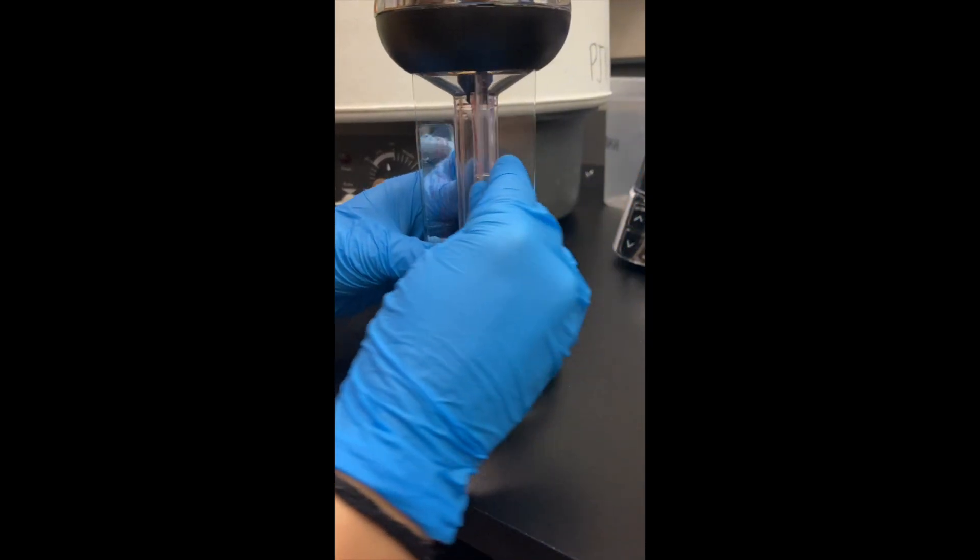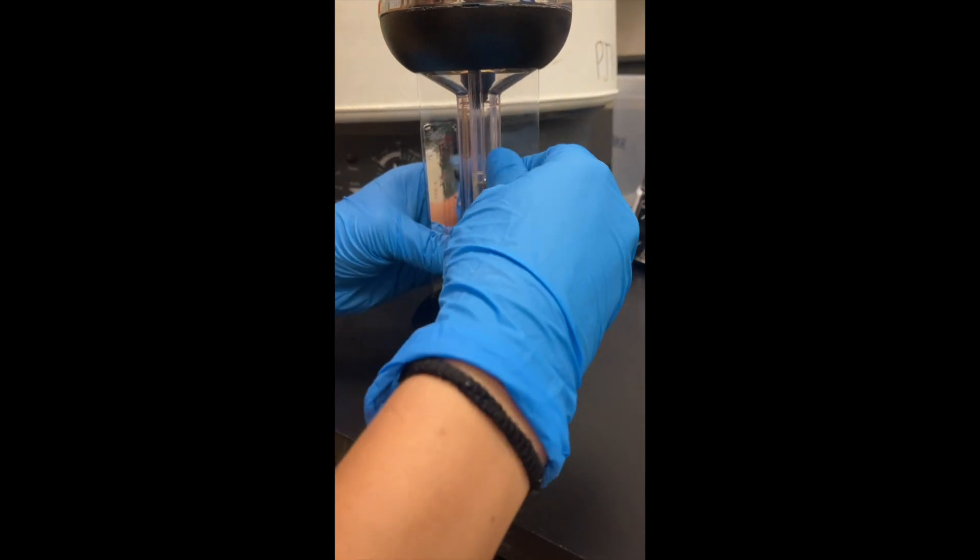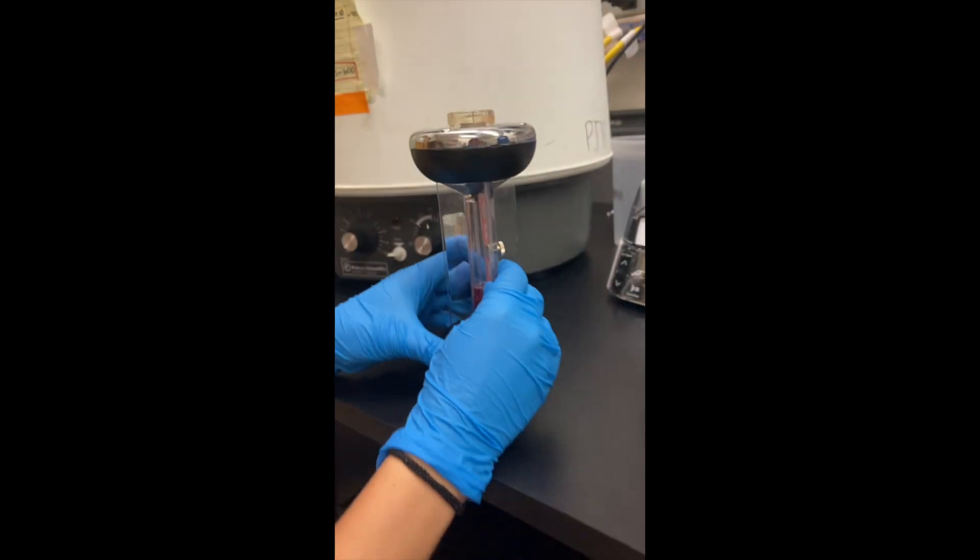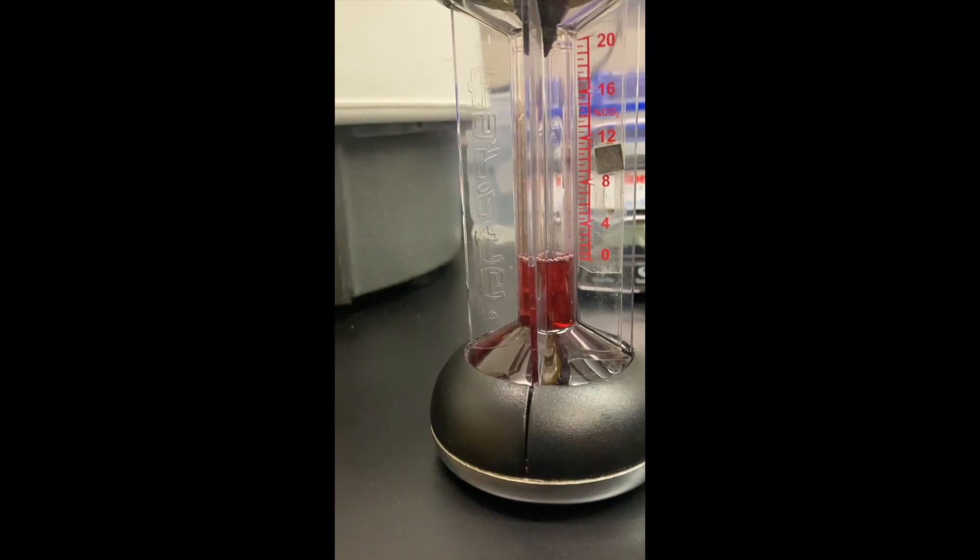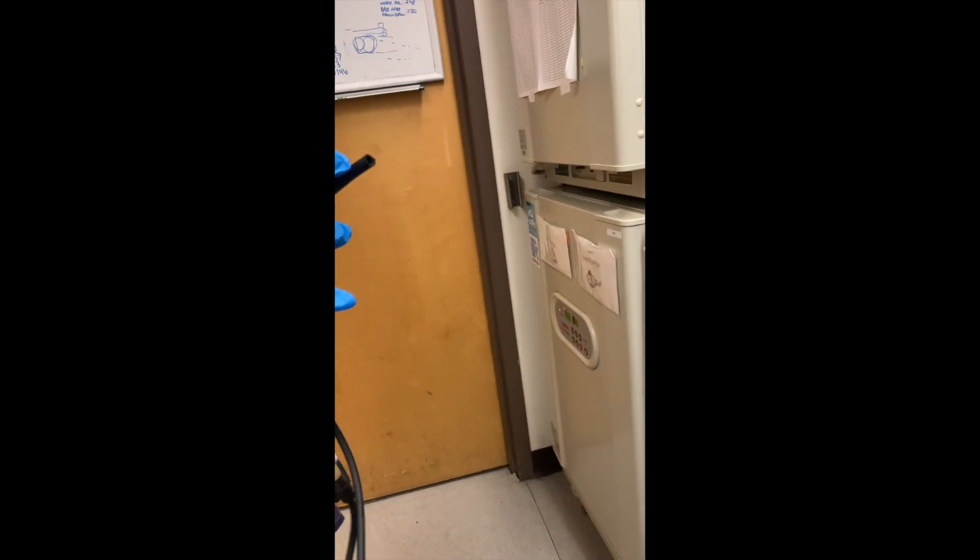So it will form some bubbles, it's fine, because it will go away. So then you lock it. So this is now our zero. So then you're gonna connect this to the incubator.